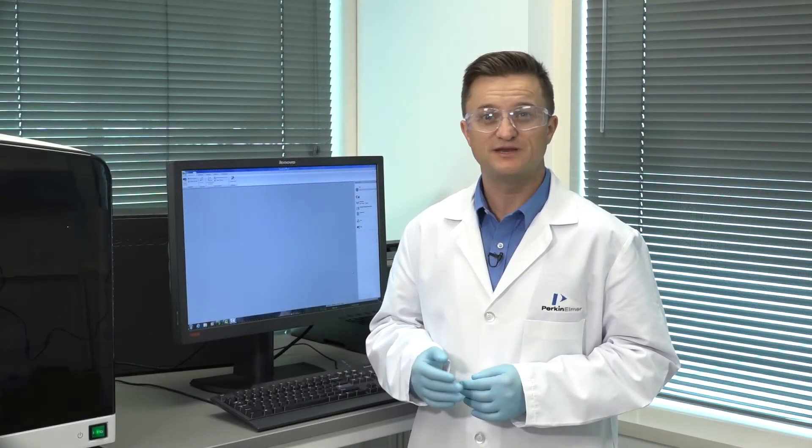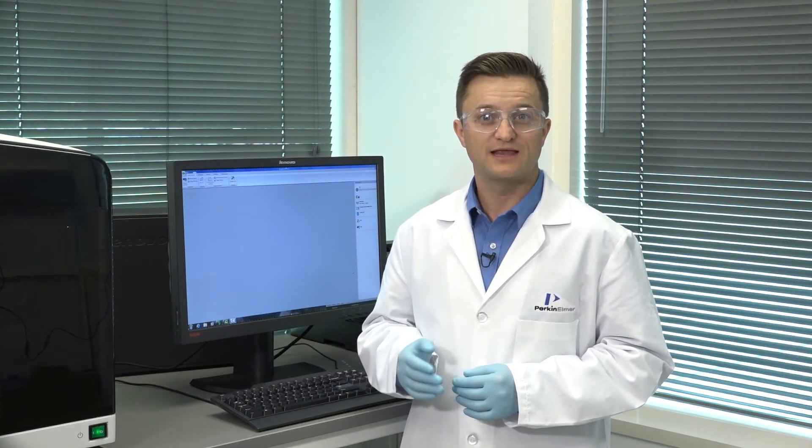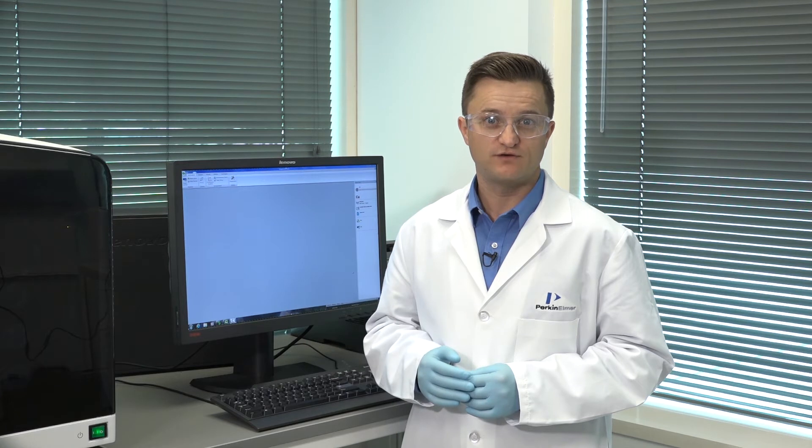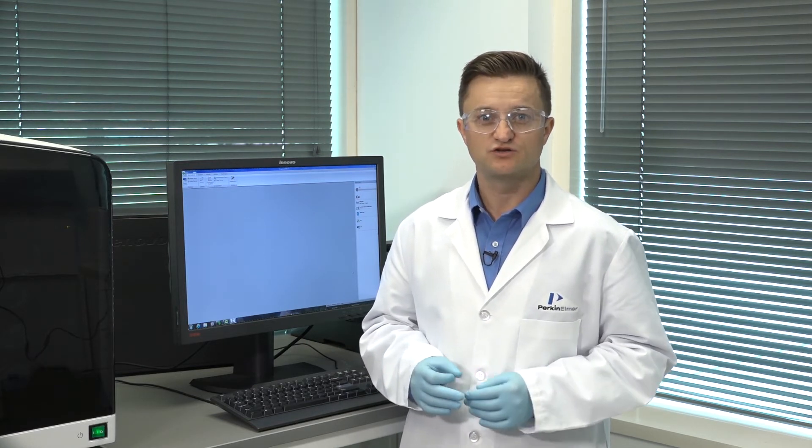Ideally, you will select a lamp that emits a beam of visible radiation. Watch our How to Align Lamps for the Pinnacle Series AA video if you do not already know how to do this. It is always recommended to use only PerkinElmer lamps in the Pinnacle systems.